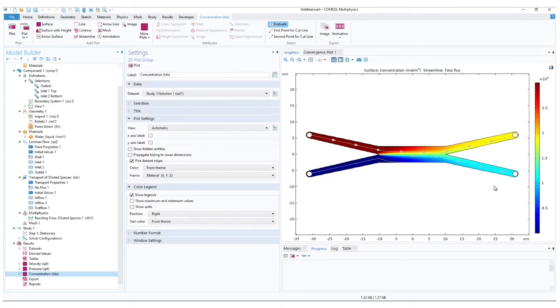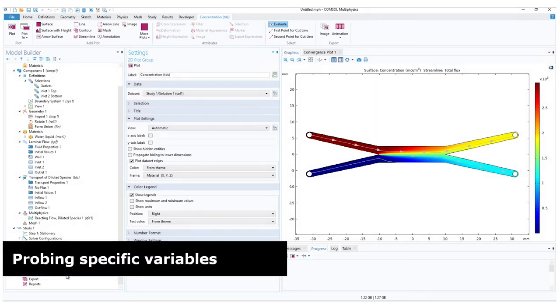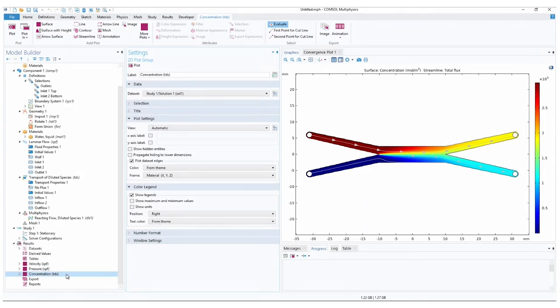This can be increased by lowering the flow rate, giving more time for molecular diffusion. However, if flow rate is critical, a longer mixing area would be needed. And if the microfluidic chip size is limited, adding flow diverting obstacles inside the mixing area can also increase the mixing rate. Besides the default graphs, we can look for more detailed information from the simulations by using probes.